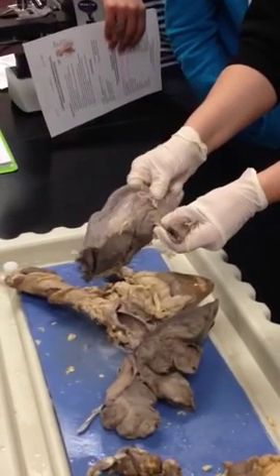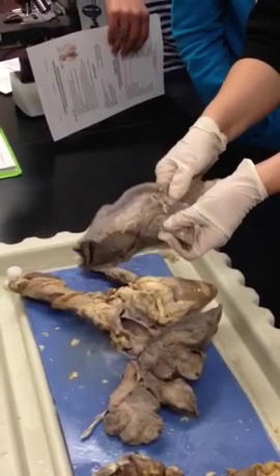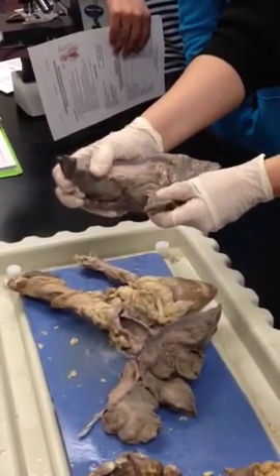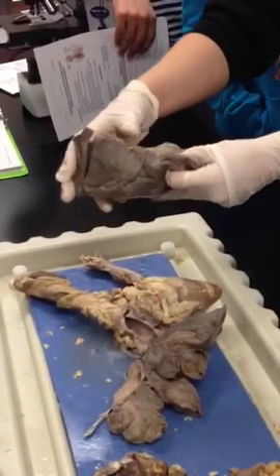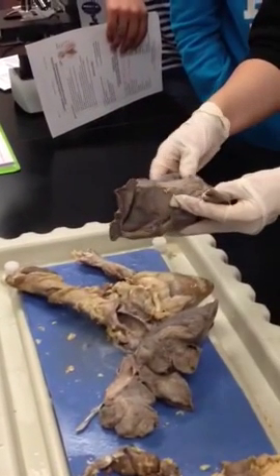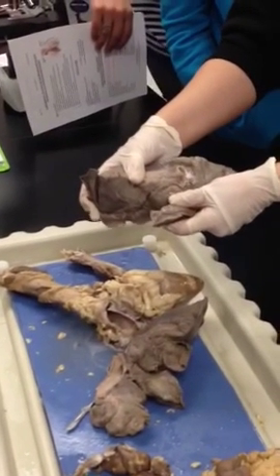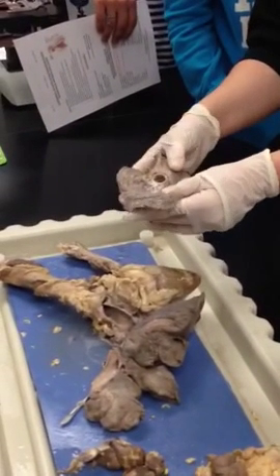This one is closer to the smaller lobe. This is the pulmonary artery. Does that make sense? So the pulmonary artery is closer to the smaller lobe, and the pulmonary vein is closer to the larger. That's always true, even in a human. We're not going to ask you on that one. I know this is super confusing, and I wish this was a real anatomy class where we actually had human specimens to work on, but we don't. So in your picture, the pulmonary artery will be closer to the superior lobe, and the pulmonary vein will be on the bottom. I believe that's what it is.